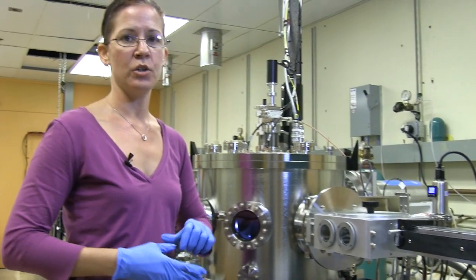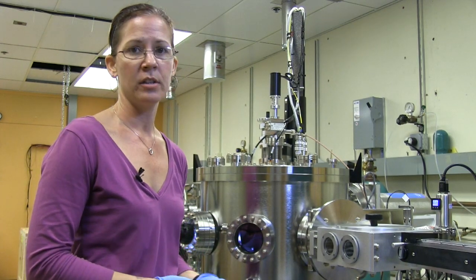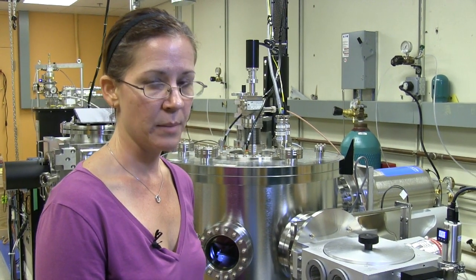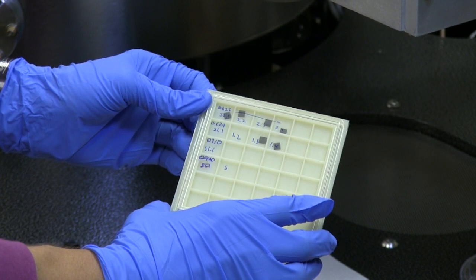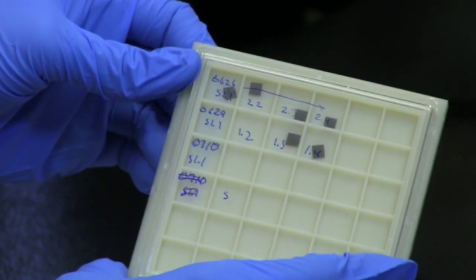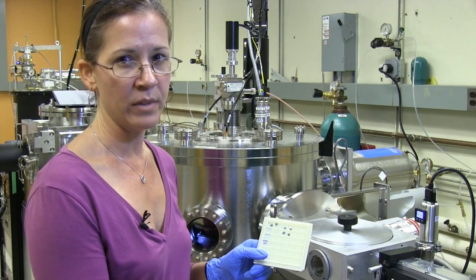So that's really it for the loading. Then you just turn the vacuum pumps back on and wait until it reaches the appropriate pressure and then load it into the main chamber. Some of the manganese gallium samples that we've already created have different thicknesses, and they're labeled based on when we made them and which sample of the day it is, so that we can refer back to that in our data to know what thickness level we're testing.